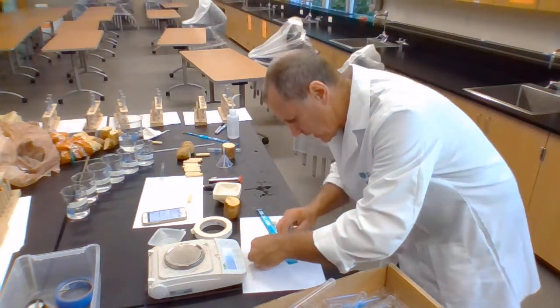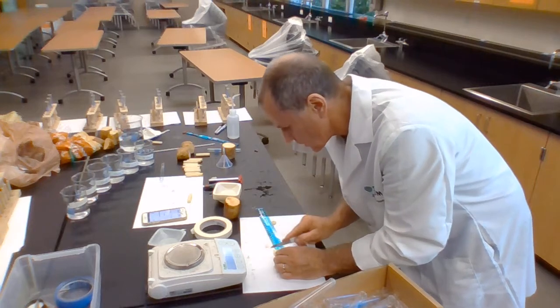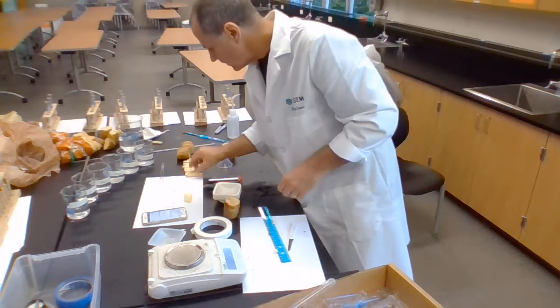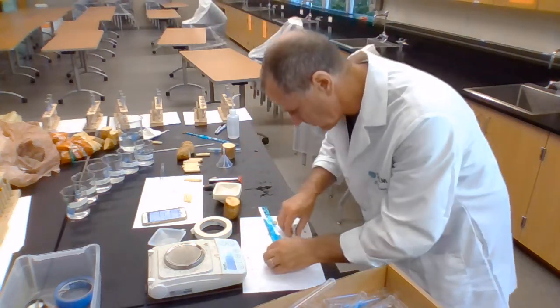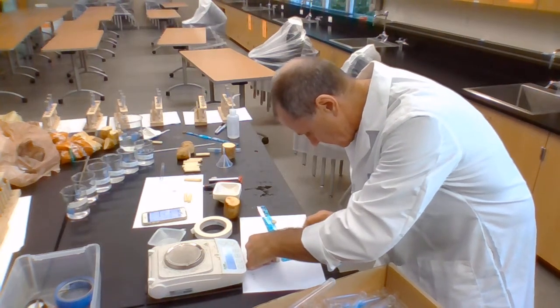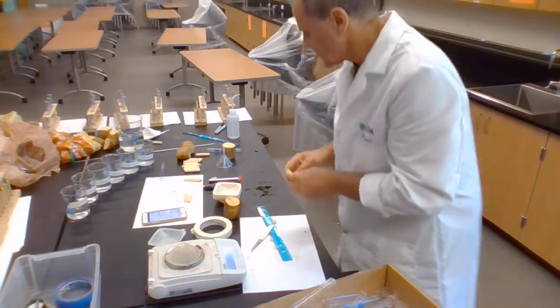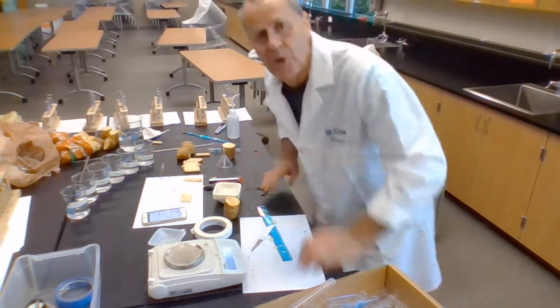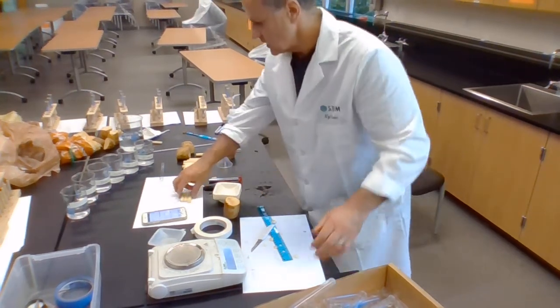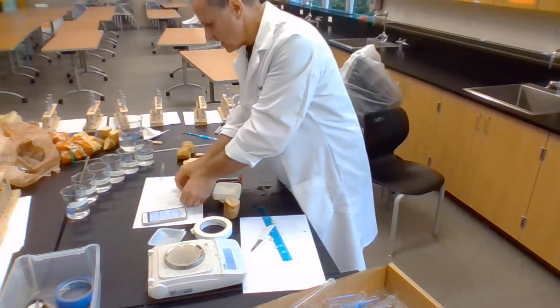Now I need to keep everything constant again in order to make sure this is a fair test, in order to make sure that the changes I observe in my dependent variable are due to the changes in the independent variable. If something else changes though, then I'm not a particularly great scientist. I realize I can't perfectly manipulate all variables, but this is pretty good. So I've now got 3 pretty well identical cylinders of potato.